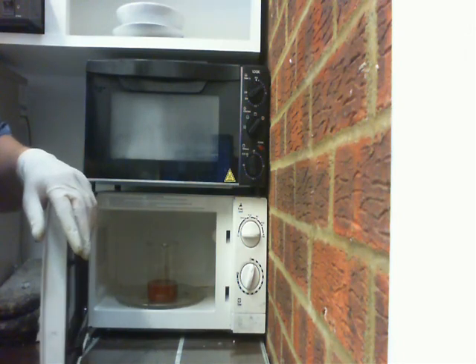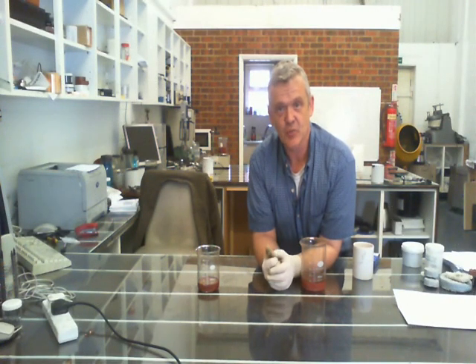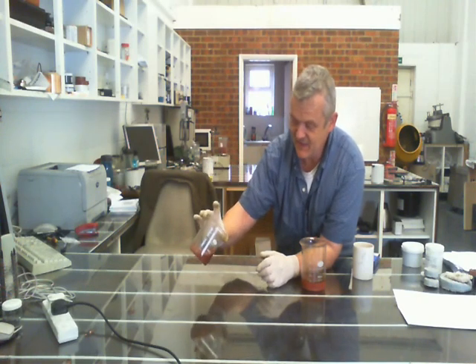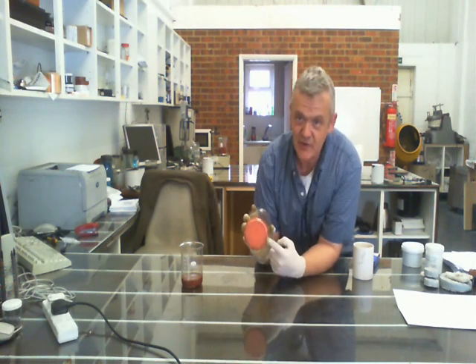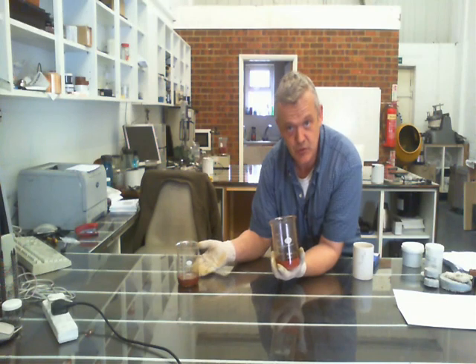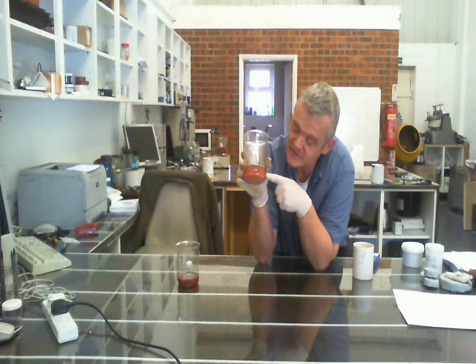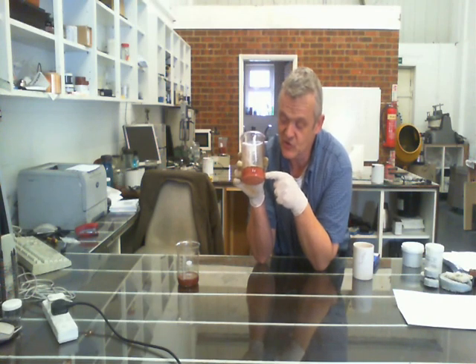Give it another five minutes and it should go from its brownish pink to its bright pink. After about 12 minutes in the microwave you can see there's a layer of bright pink at the bottom — and that pink is the telltale colour for copper nanoparticles. You need to leave it at about 50°C so the gelatin doesn't set, and then the large particles sink to the bottom, the medium-weight particles stay in the centre, and the lightweight particles go to the top. That centre layer is medium-sized, gelatin-coated, water-dispersable copper nanoparticles in copper formate.